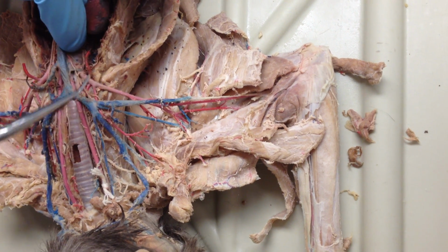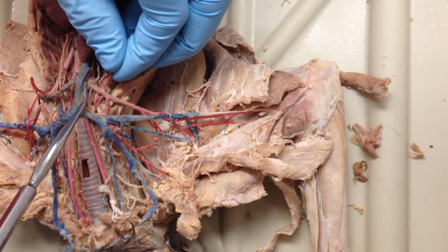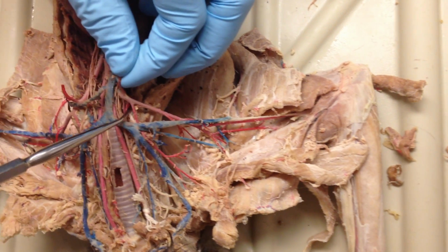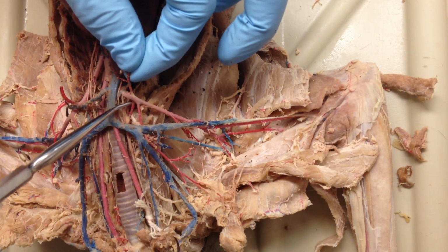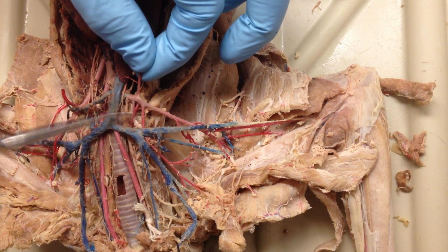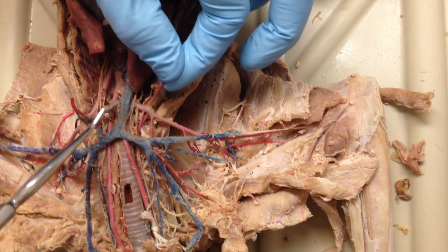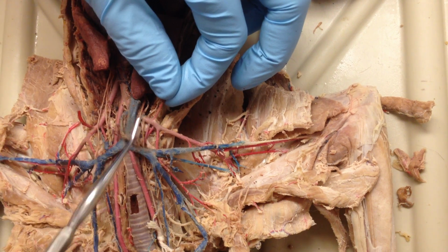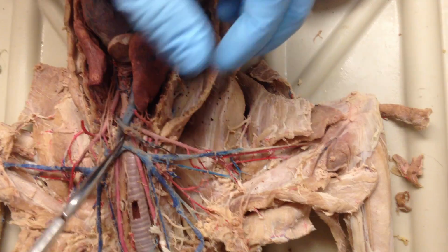Back up to this area. The 2 that go into the body, unlike the vein, which is a costovertebral, you have 2. One of them is the vertebral, which goes into the body towards the vertebra, which is straight down, so it's this guy actually here. And this one you can see is kind of running forward towards the head, so that's the costocervical. Then the one in my hand here that I'm pulling on is the internal mammary, which is different. You have 2 of those, one on either side for the arteries. You only have a single one coming off the sternal in the vein.